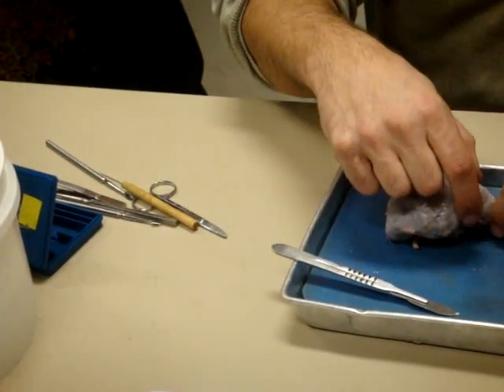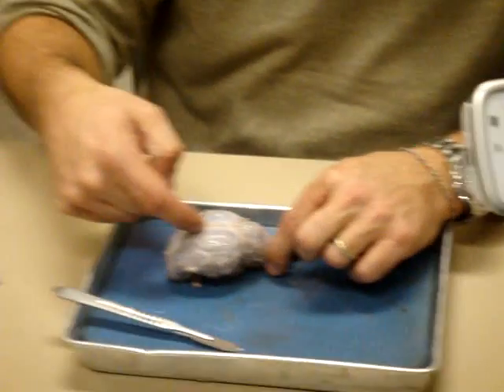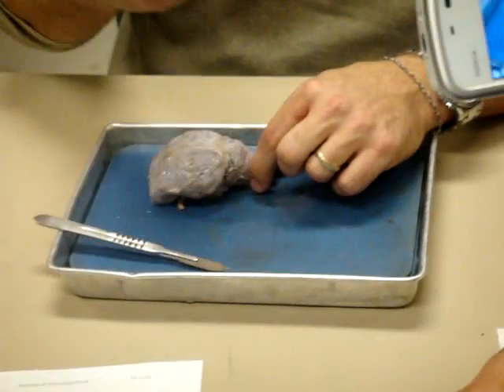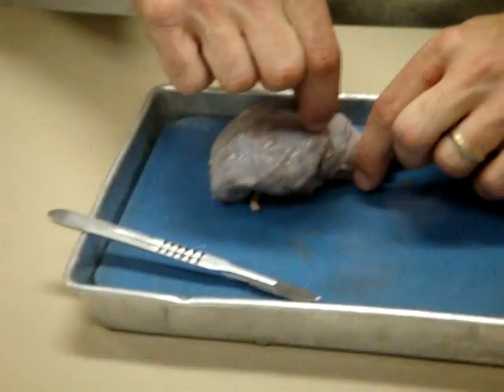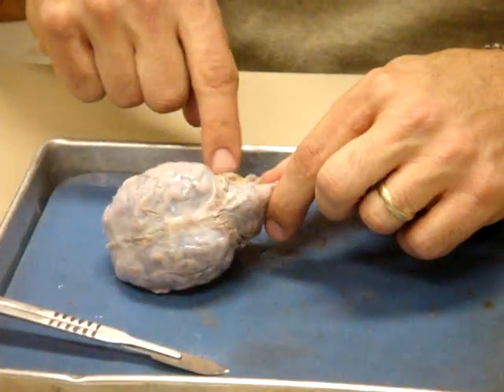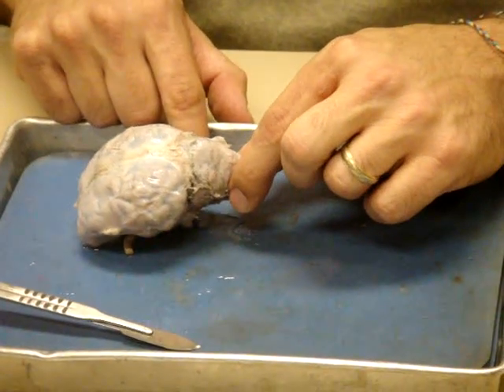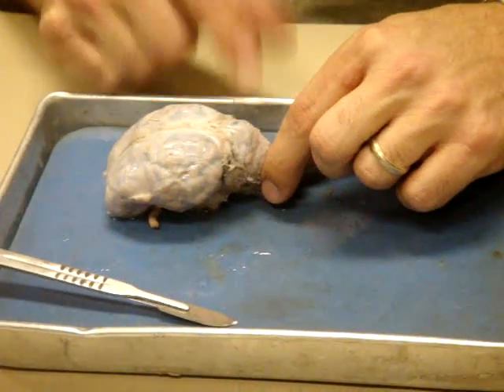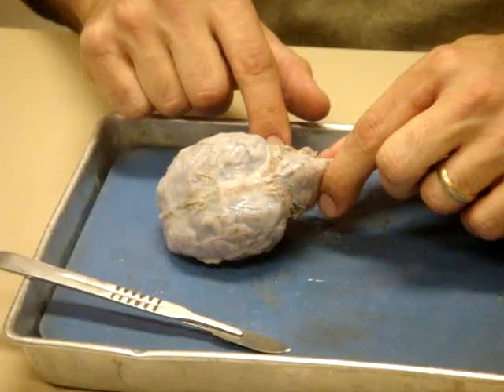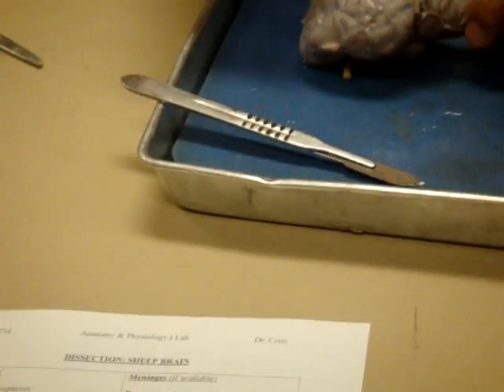So what happens is it separates there too, and that's where we have our transverse sinuses. So blood will flow back here, you know, remember, from the arachnoid villi, draining the CSF and any blood from the brain in there. And then it joins with these transverse ones, and then it comes around down to the, where? Where's it going to leave the brain? Through what foramen? Jugular, yeah, the jugular. Jugular veins will come down from here. So it flows this way and then around both sides and around and down.